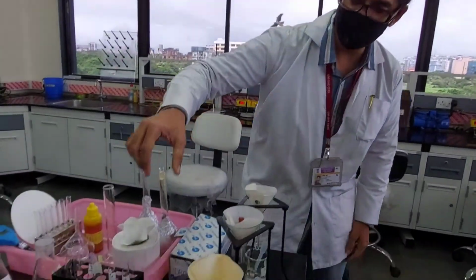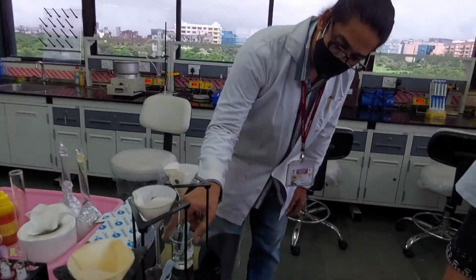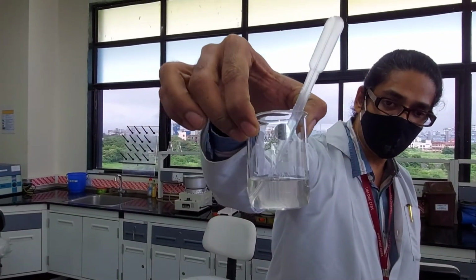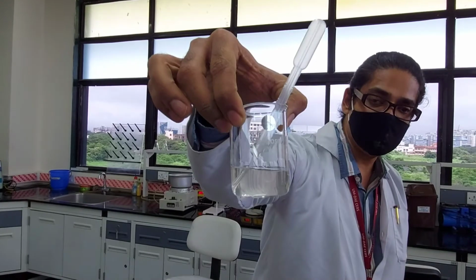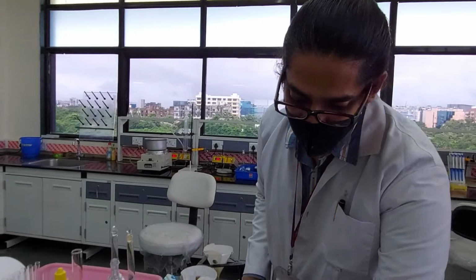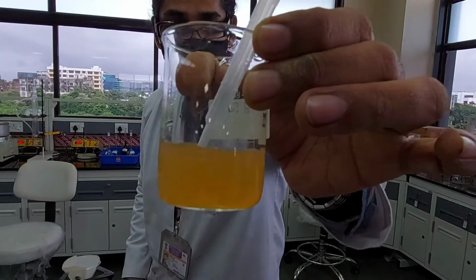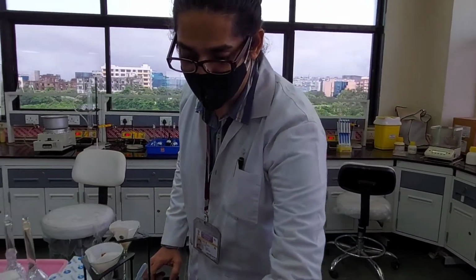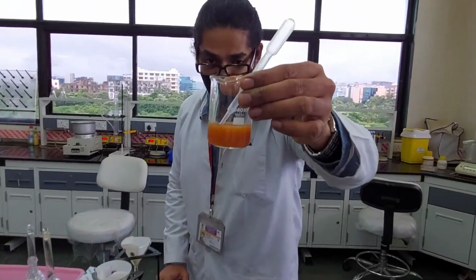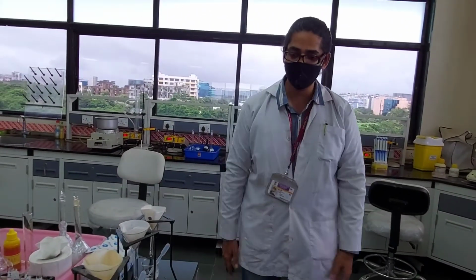And if you put such a slurry through, these are the kind of solutions you will get. These are the filtrates. Not necessarily for every soil will you get a clear solution like this. The red soil itself has its own color, so even if you filter it, you will get some reddish tinge. But nevertheless, we had taken care to remove all the particulates. The other soil is quite red in color, but we have to live with it. That's the nature of the soil.